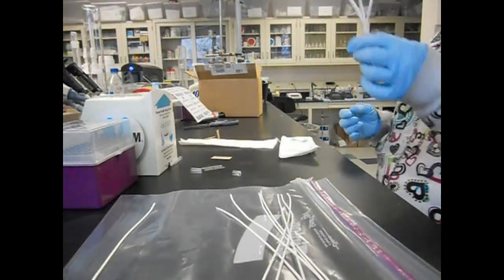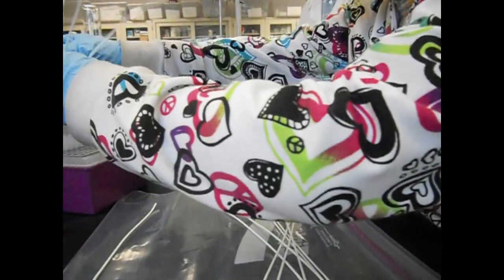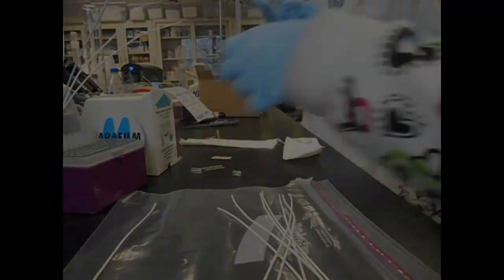And next we can put glue on them. Maybe we'll find something to let them stand and dry.